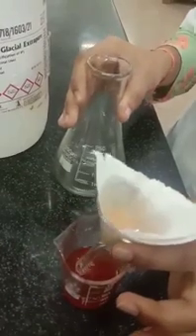Filter the crystals and wash the crystals with glacial acetic acid. Dry the product.